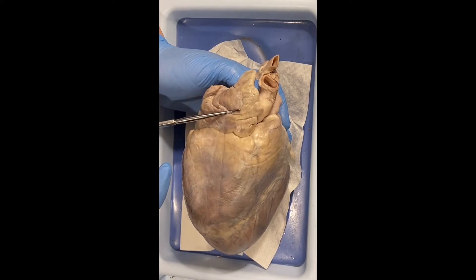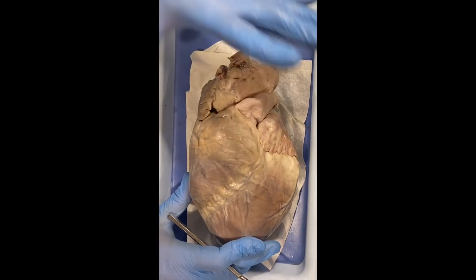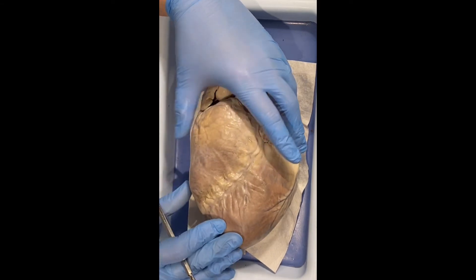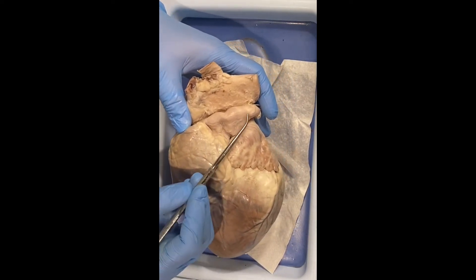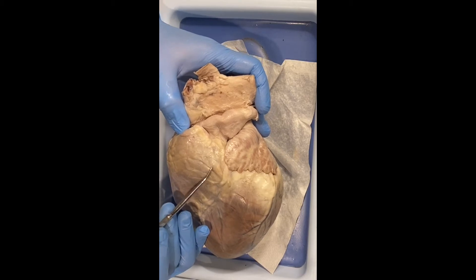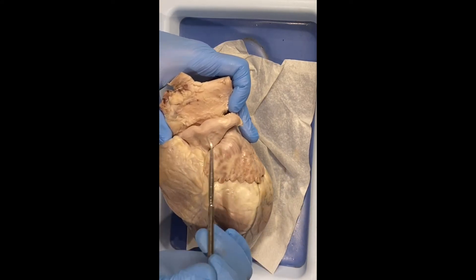We go from the right atria, through the tricuspid valve, to the right ventricle. When the heart contracts, it contracts as one unit — the top contracts and it continues down to the apex of the heart and back up in a fluid motion. When the ventricles contract, that forces blood out through the arteries. Another valve prevents blood from going back in; these are referred to as semilunar valves.